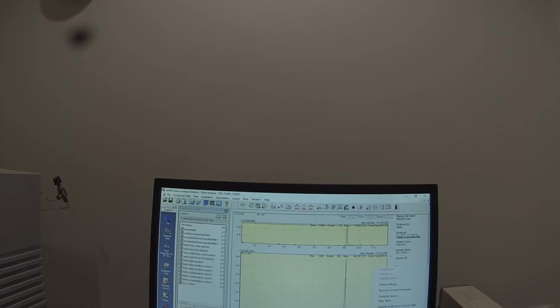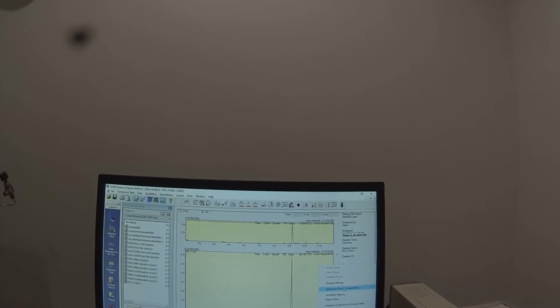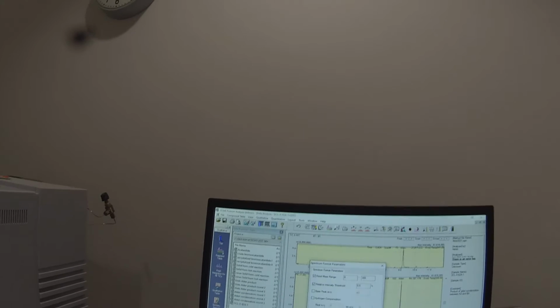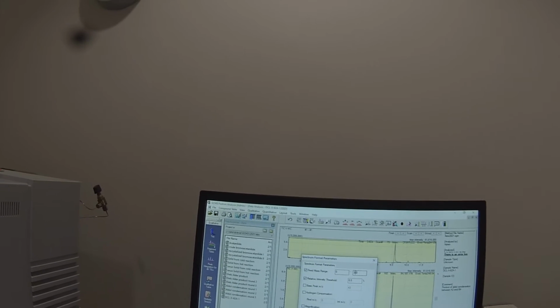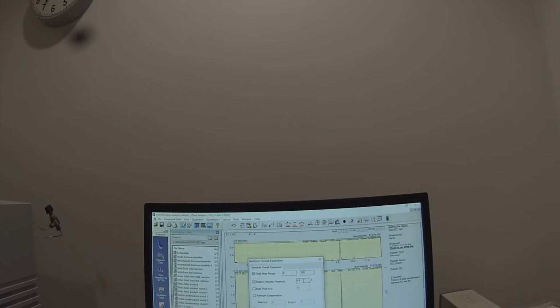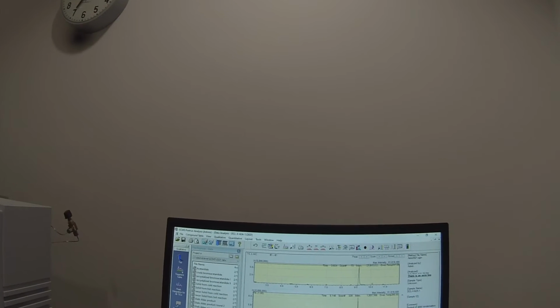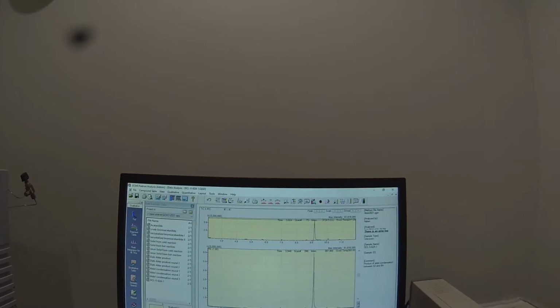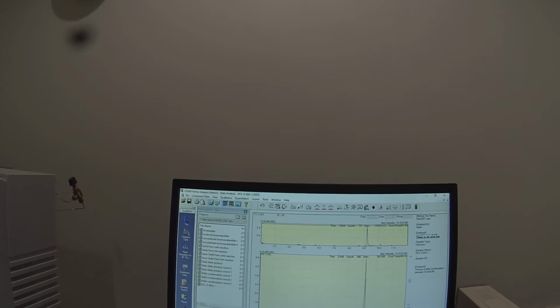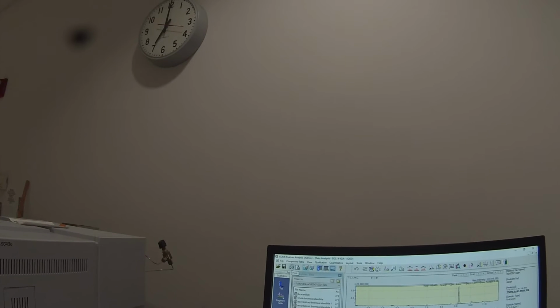Somewhere there is a, maybe if I right click on here, spectrum format parameters, what's that do? 0 to 300, relative intensity threshold is set at 0.5. I'm going to set that to 1. And hopefully that'll make some of those peaks go away. So we still got the big peak at 250. I'm going to save that data file.